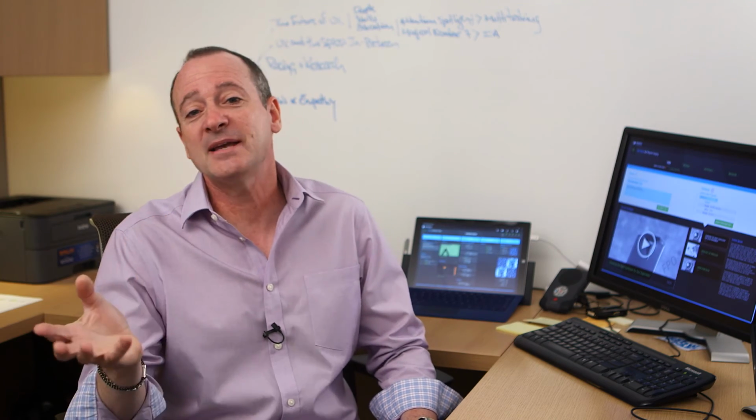And in fact, the best comment we received was from a scientist who told us that this was the sleekest scientific interface he had ever seen.